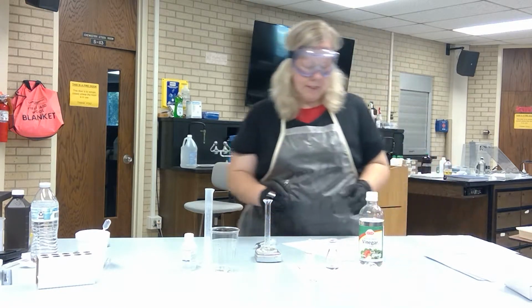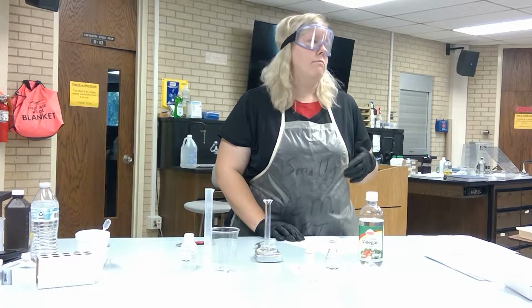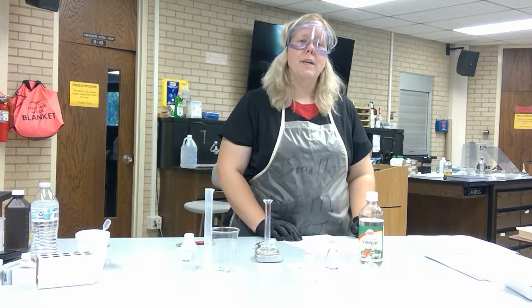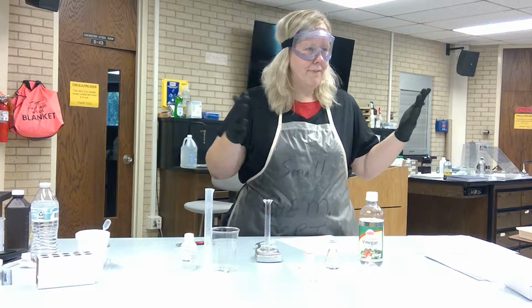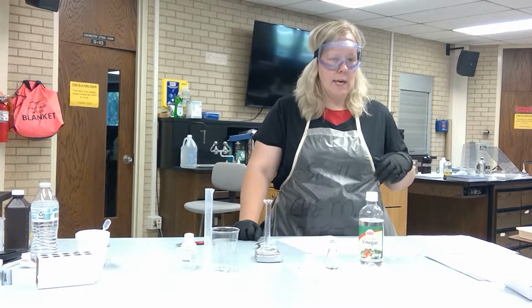There we go. Okay. So you're going to have to pick a vinegar of your choice, if you've got some. Let's see. Balsamic vinegar. Yeah, balsamic vinegar. Red wine vinegar. Yeah. See, all these vinegars come to choice. They're just, red wine sounded good. But your choice. If you have something at home, use that.